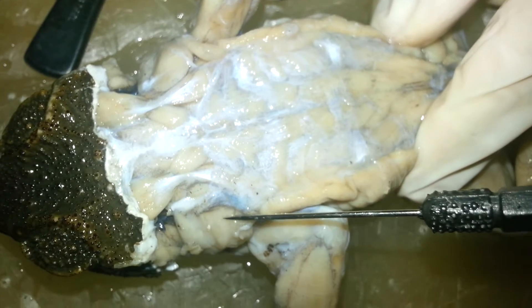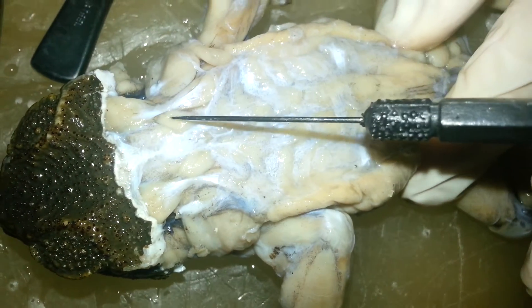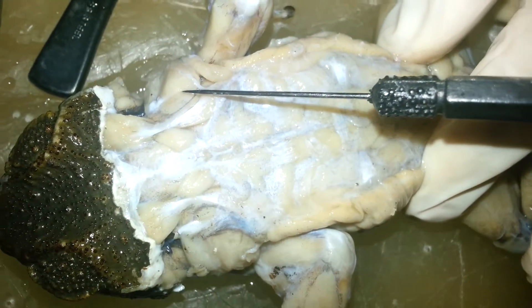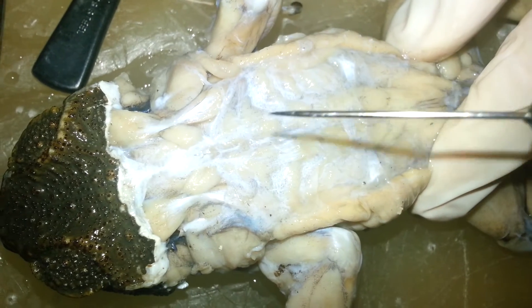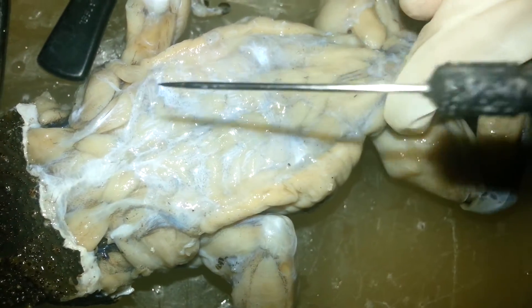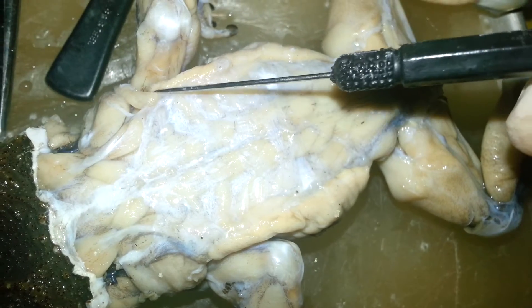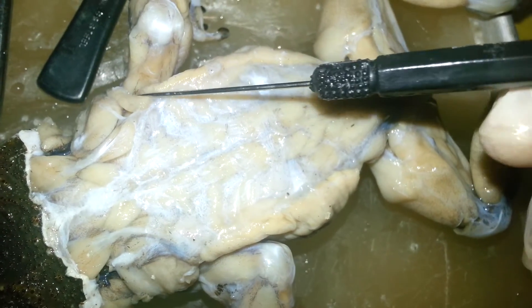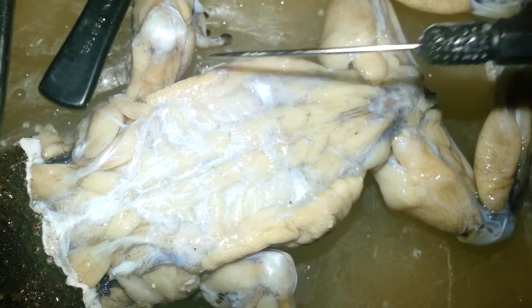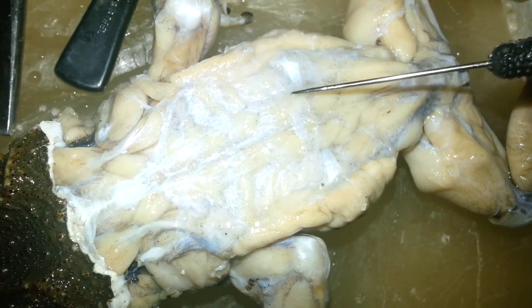Dorsalis scapulae. Trapezius. Latissimus dorsi. Longissimus dorsi.